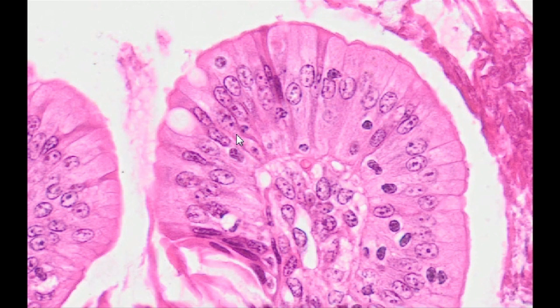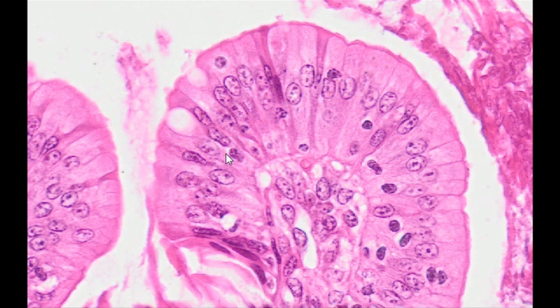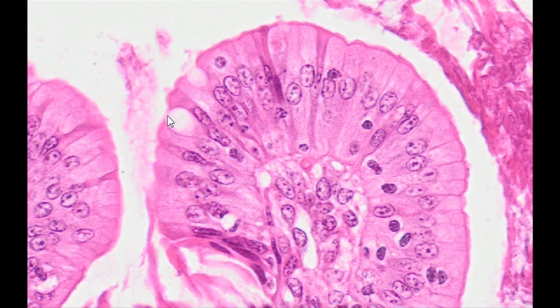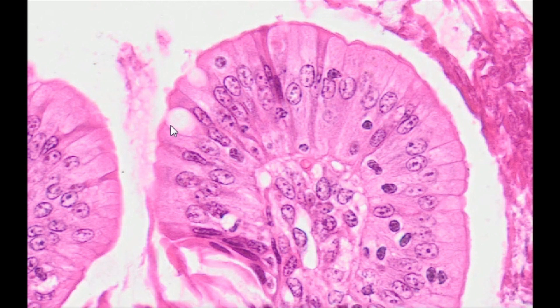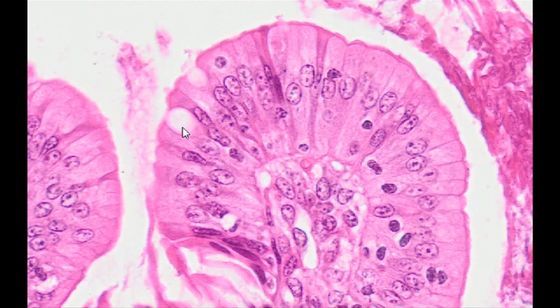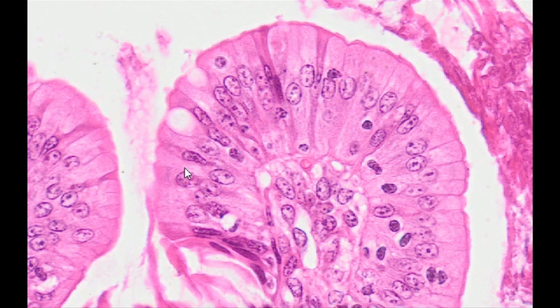2. Undifferentiated cells, resting low on the basement membrane. And 3. Goblet cells — cells responsible for the production of mucus, characterized by the presence of a large vacuole, the content of which does not stain with H&E. There are no microvilli on the surface of these cells.